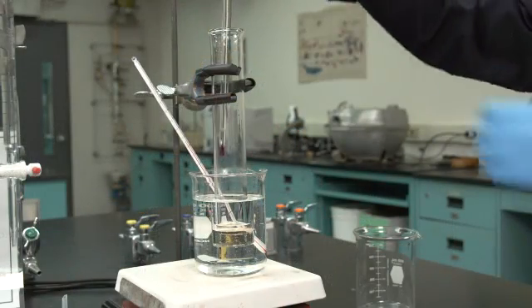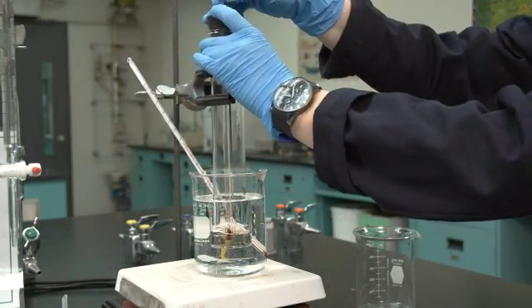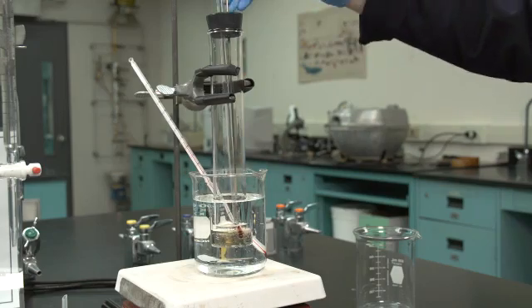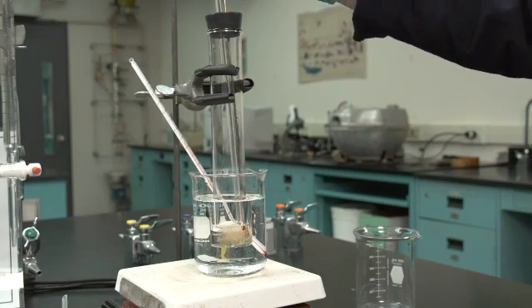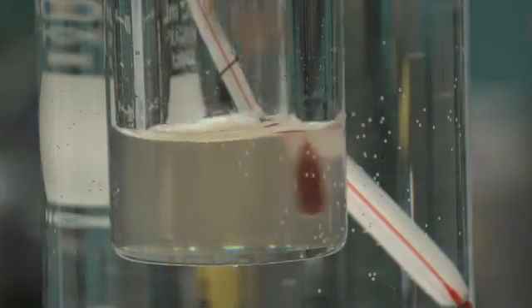The contents of the tube are stirred with a wire stirrer and heated slowly in the bath. Read and record the temperature at which the solution changes from cloudy to clear.